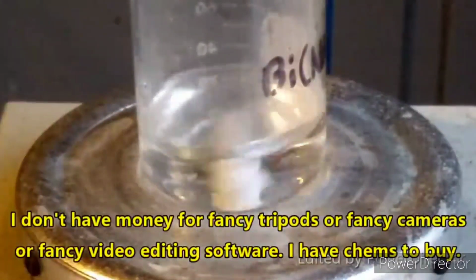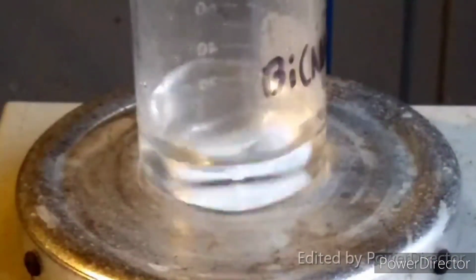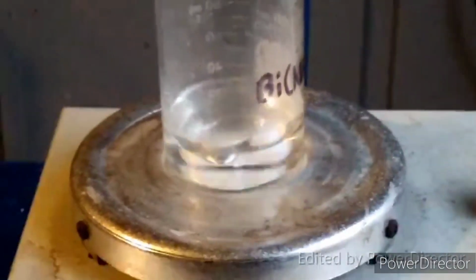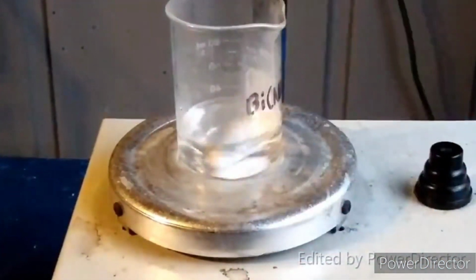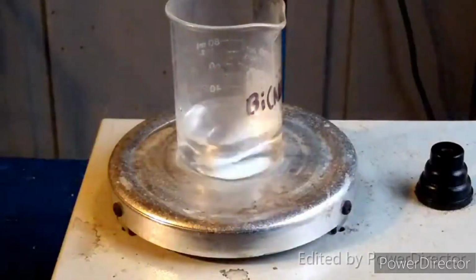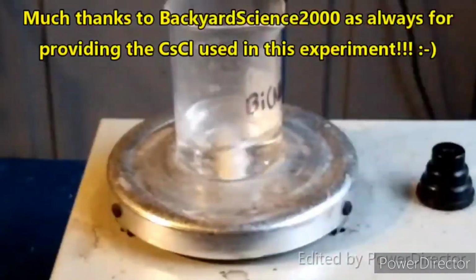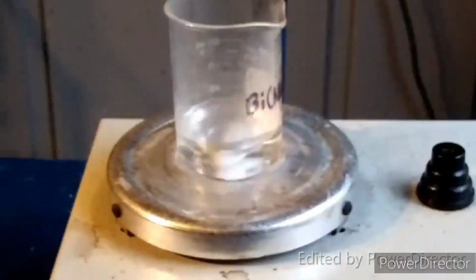Alright, now the next thing that we are going to do is take 5 molar equivalents of potassium iodide, and we are going to dissolve this in some water. Now, we are going to take some cesium chloride. Got that here. And we are going to dissolve this in some water. Okay, stir that up.